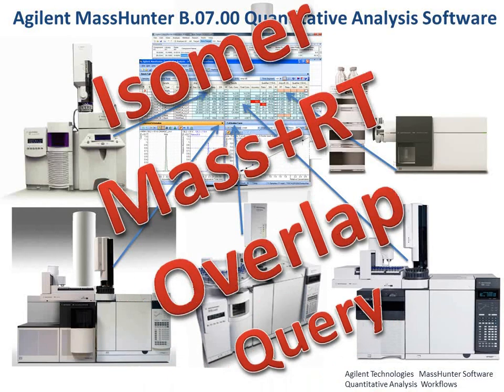Let me introduce you to a query that will help you look for misassignments. Sometimes isomers are difficult to assign correctly, and this tool will search through your determinations and present those cases to you one at a time.